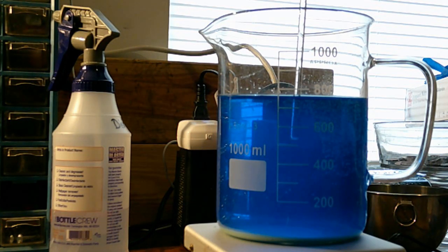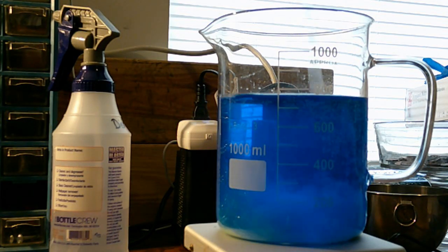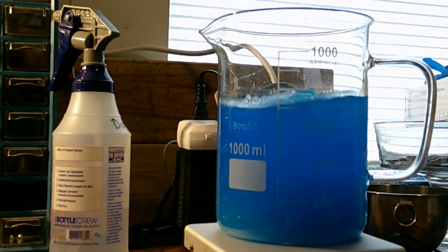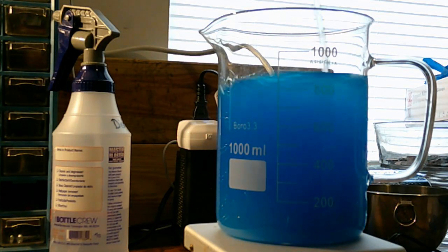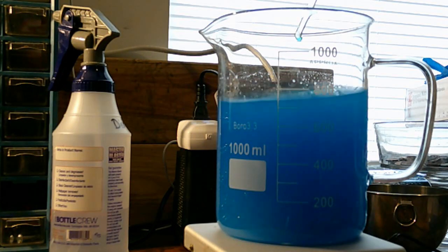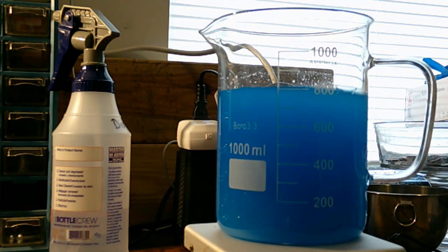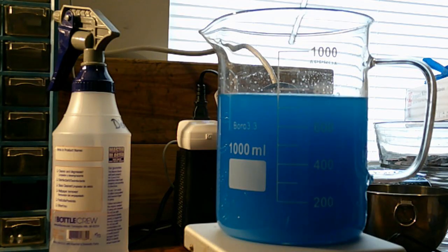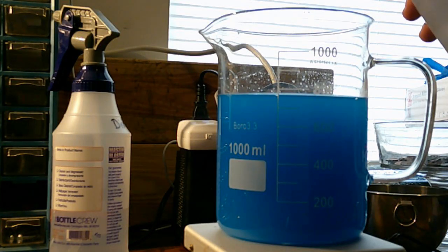So I'm going to show you this. There's only a gram in there. Let me go in here and I'm just going to stir this for a second. You ready? Look at that. That is now going to take two or three hours to settle again. So I probably won't get to do this again until this evening.